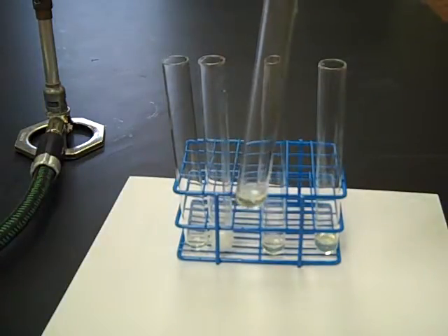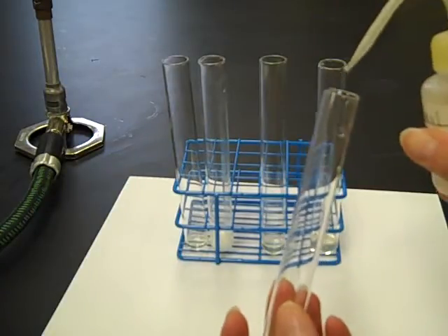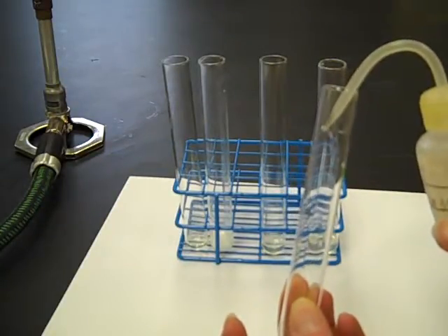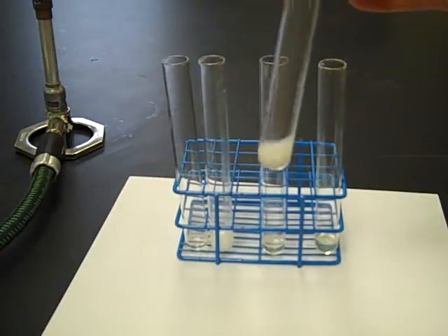To this test tube, we're going to add ethanol, 95% ethanol. The same result, precipitation.